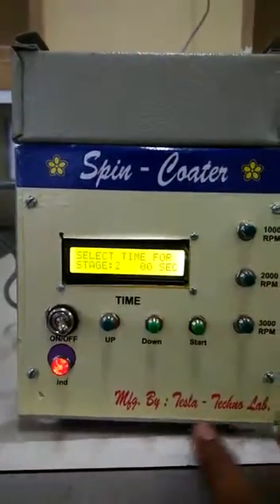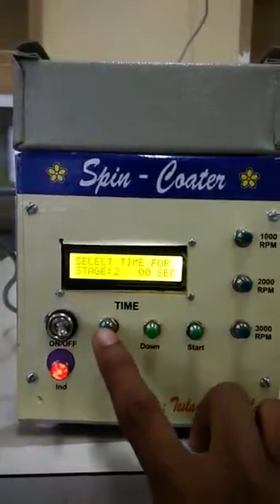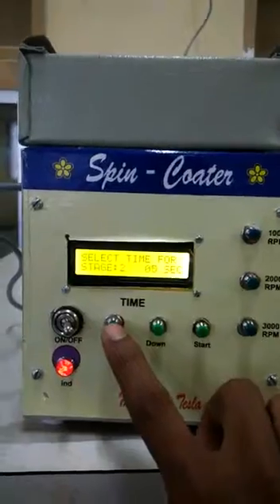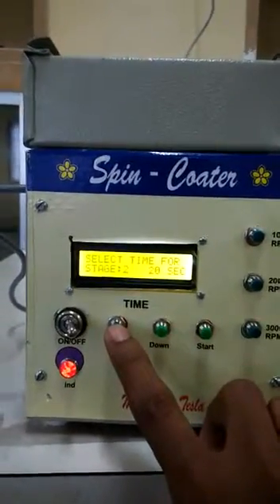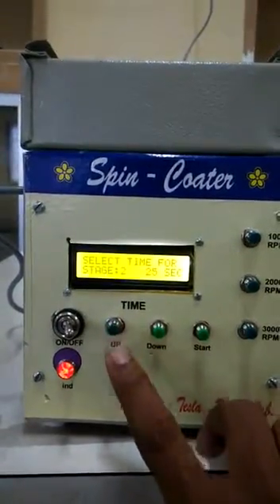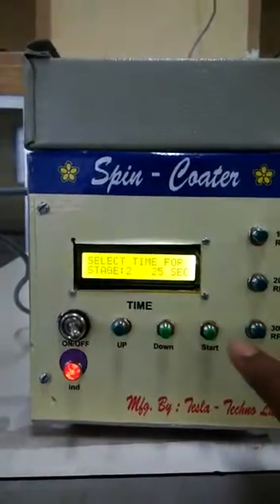For stage two, you can give whatever timing you want. Suppose I am giving it as 25 seconds.